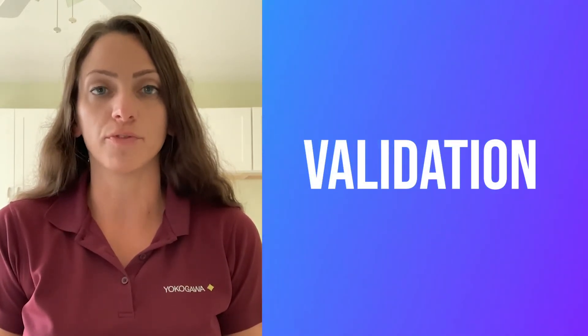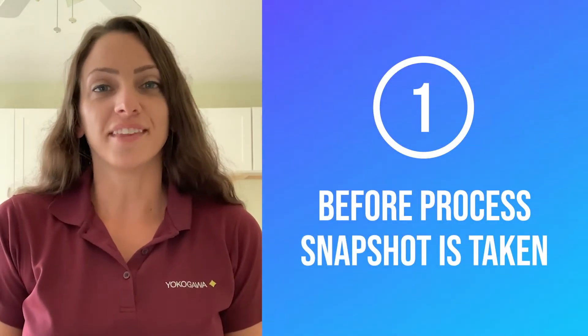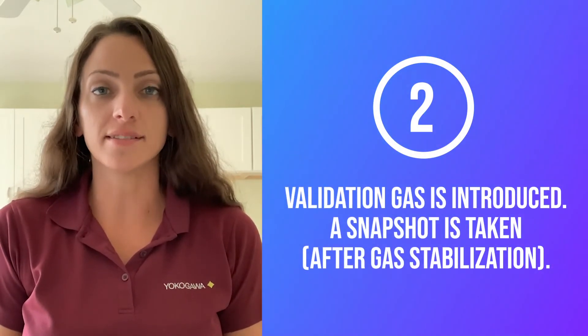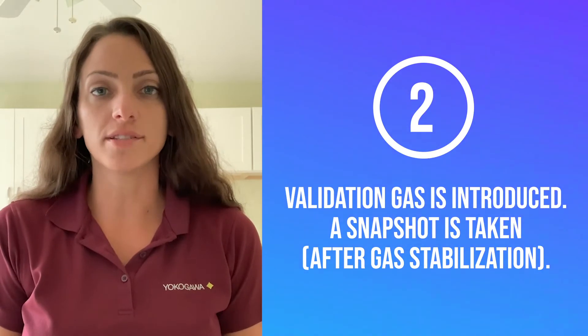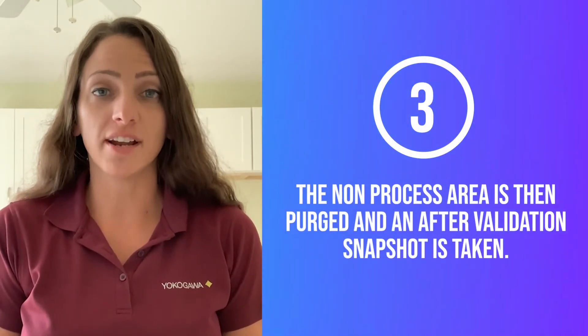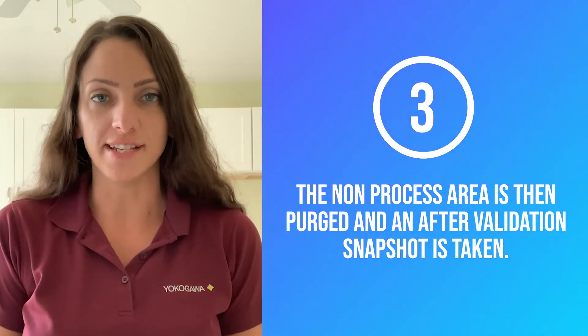There are four steps that occur when validation is performed. Number one, the analyzer takes a before snapshot of the process. Number two, validation gas is introduced into the non-process area. Once the concentration has stabilized, the analyzer will take a during validation snapshot. Number three, the non-process area is purged out and the analyzer will take an after validation snapshot.